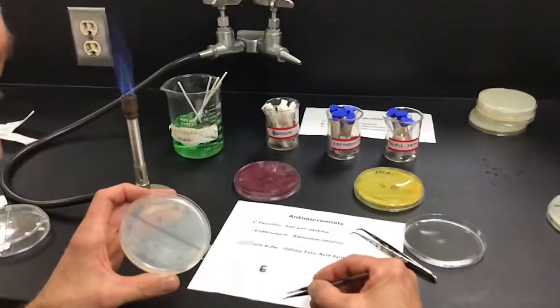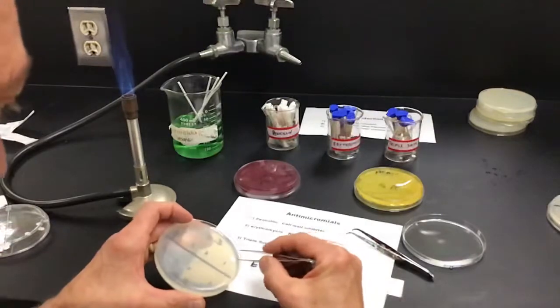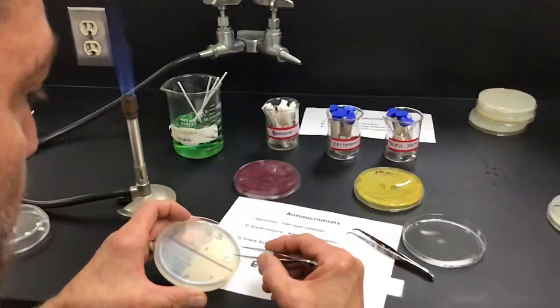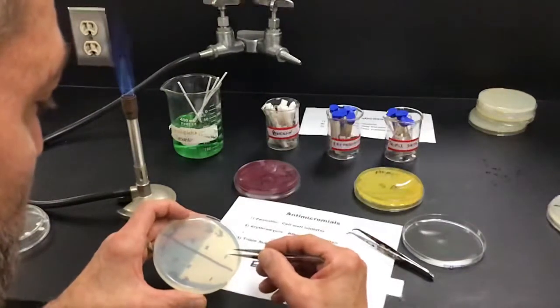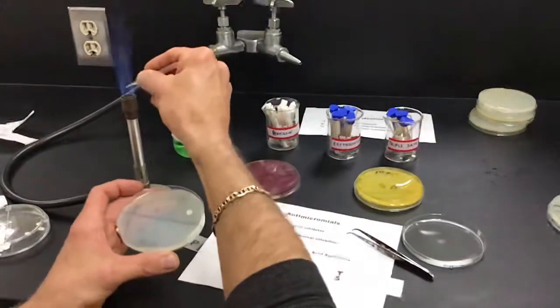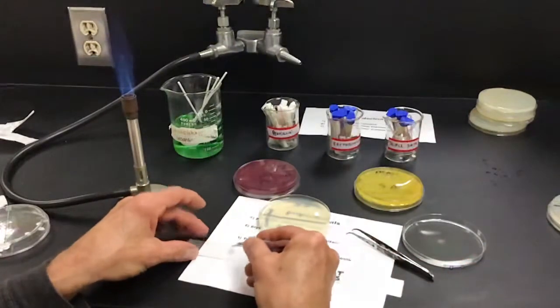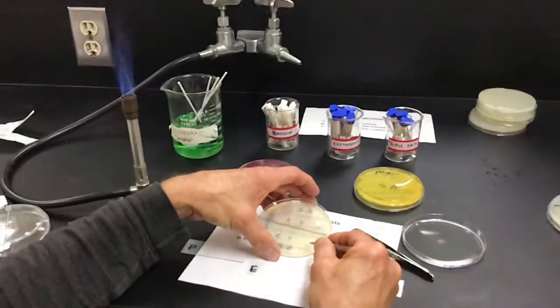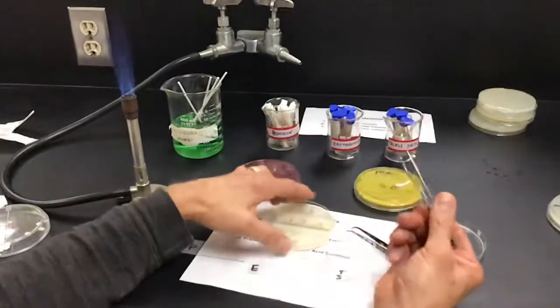Good Lord. Now normally whenever you drop these you just leave them here, but that was too close to the side. So we want to make sure we can really check our zone of inhibition. That one. Wow, that one way better. All right. So we have one in our E. coli, one in our Staph aureus.